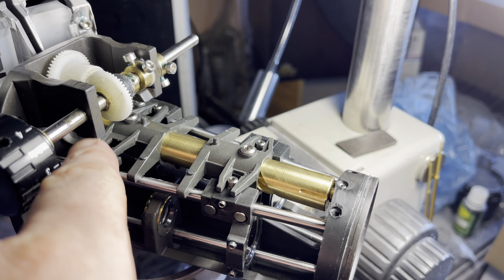The Leica blocks are held by three bolts. Synchronization is achieved by a special connection, and the limit of expansion is set with a hook-like piece. Mechanically, this Leica is made in a pretty innovative way.